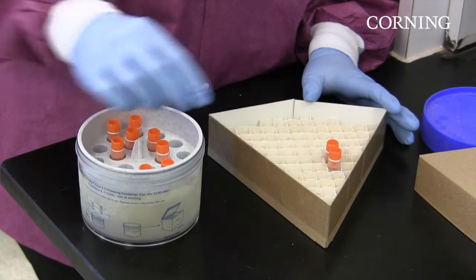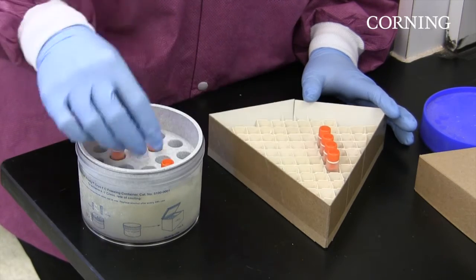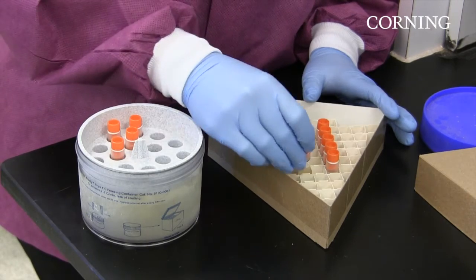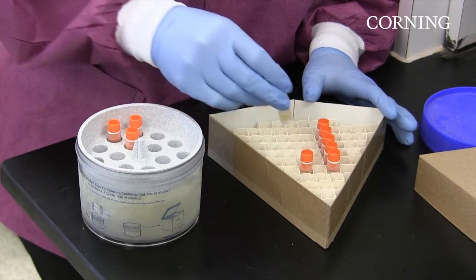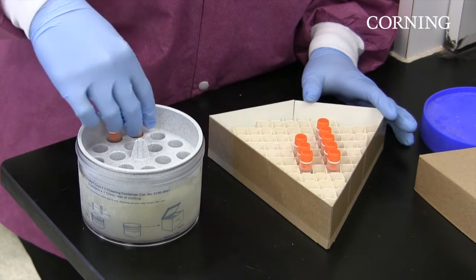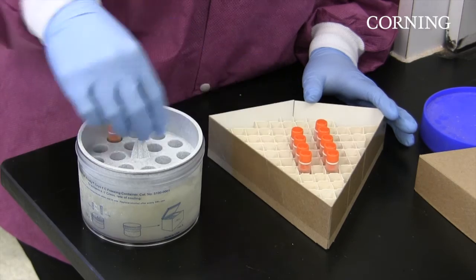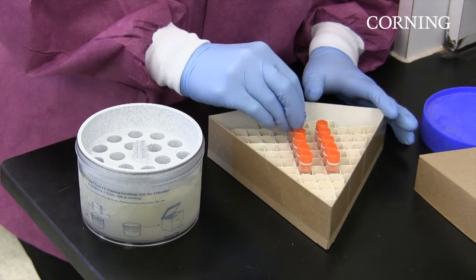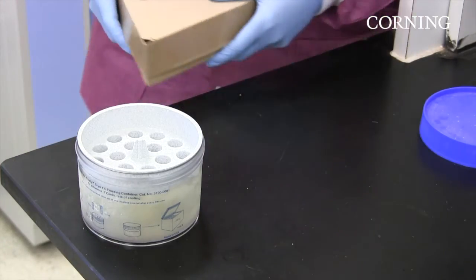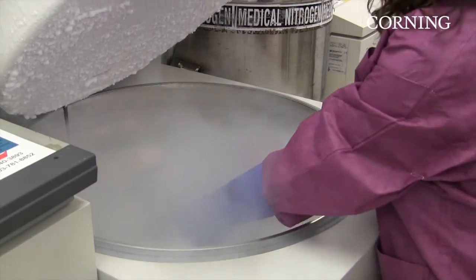Avoid storing cells in the minus 80 freezer for long periods of time as this may result in cell death. When storing cells in the liquid nitrogen freezer, it is important to store the vials in the vapor, not the liquid phase. This will reduce the risk of contamination and damage to the vials during thaw. It is important to know the level of liquid nitrogen in the freezer to determine at what height the cryogenic vials should be stored.